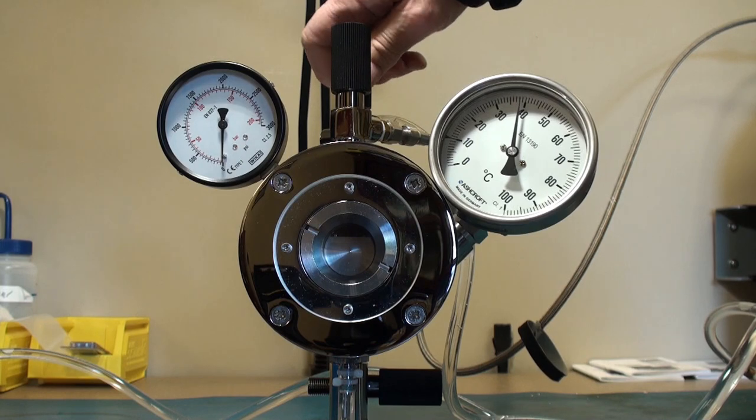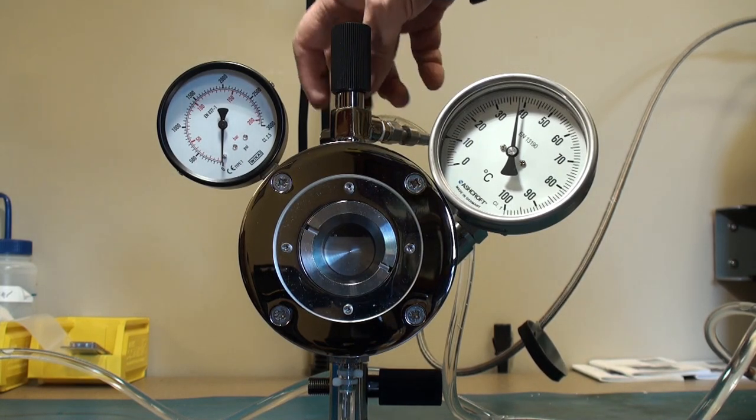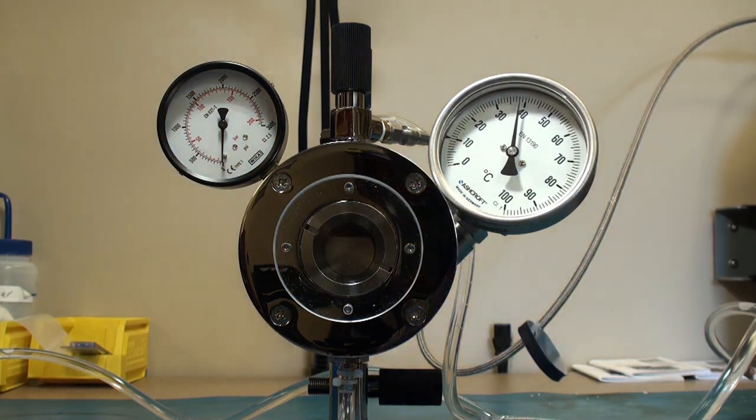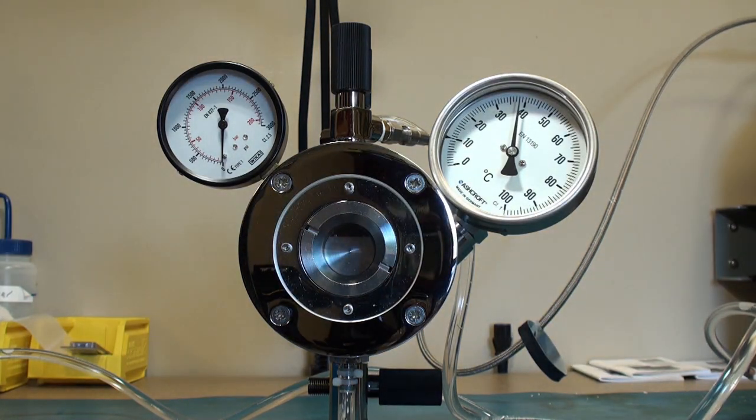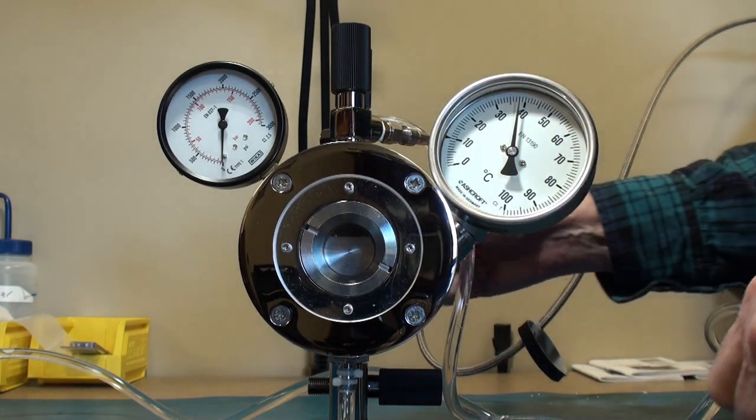Manometer reads zero. Opening the valve quite a lot to make sure that all the pressure is out of the chamber.